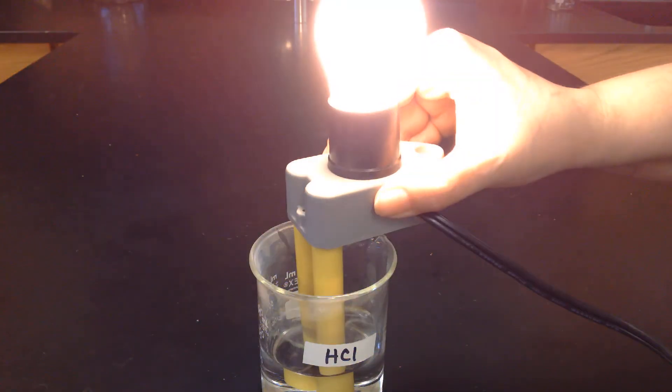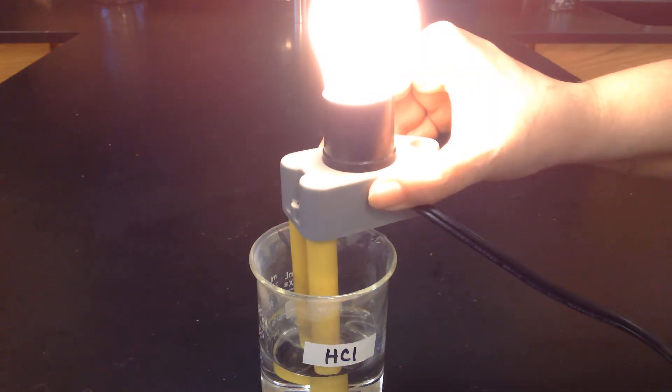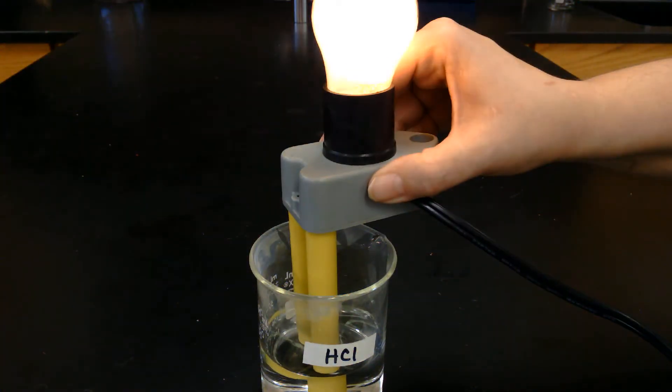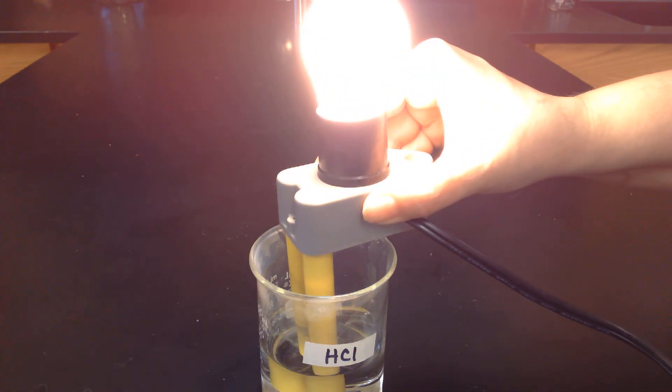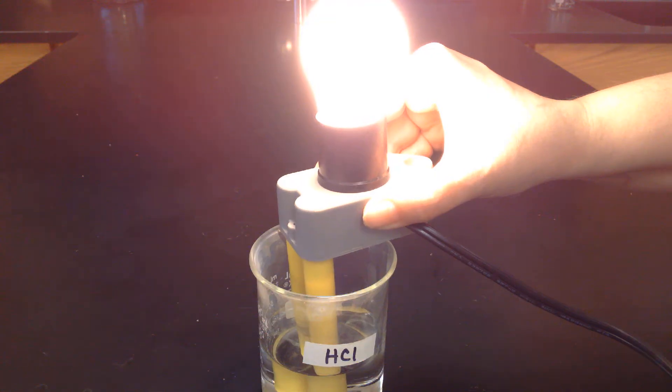Now we're going to try some hydrochloric acid, HCl. Very bright — very bright! Go ahead and make your observations of that.